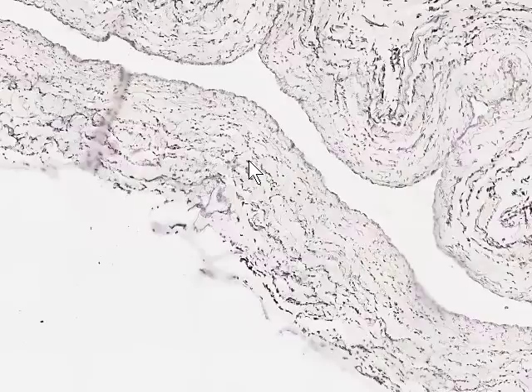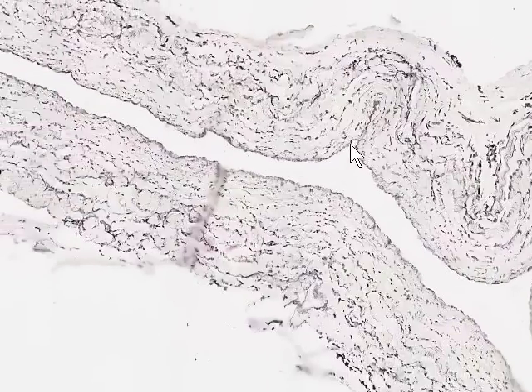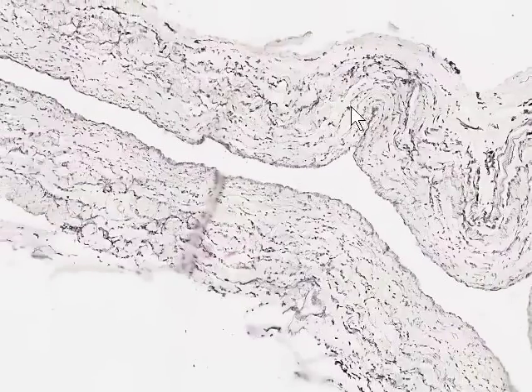And this is probably indicative of elastic fibers which are oriented with their long axis paralleling the long axis of the vessel, so they've been cut in cross-section in the tunica media. However, as we move out to the tunica adventitia, as we would see out here, we start to see short, occasionally branched, thin elastic fibers present in the tunica adventitia, but not as many as you would find in the accompanying vein.